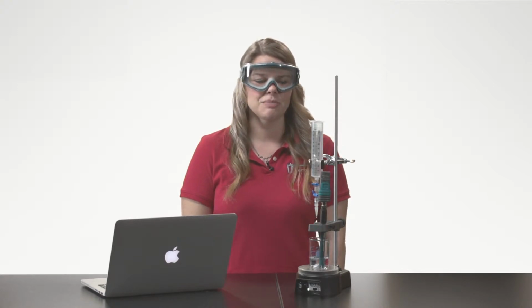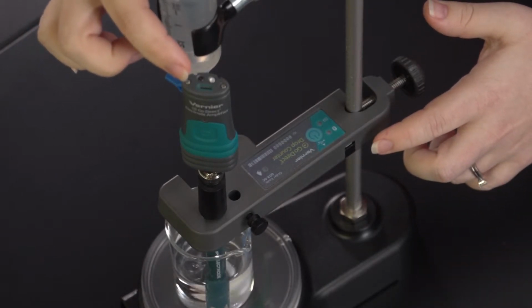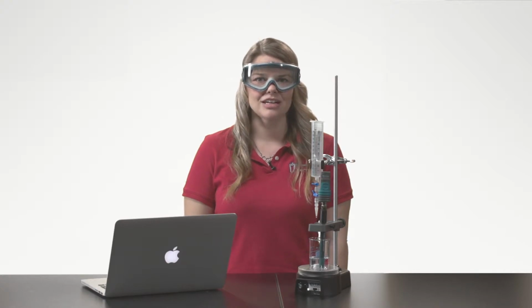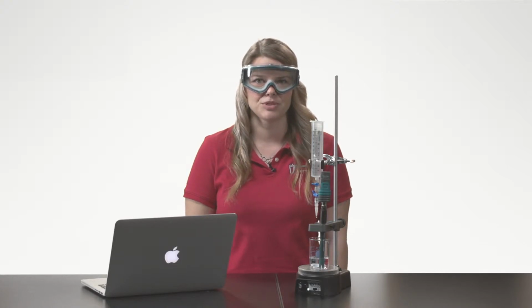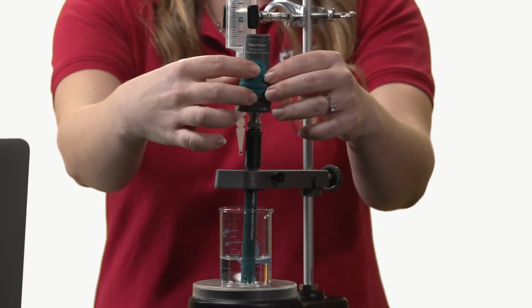The GDX-pH sensor and drop counter can be connected via USB or via Bluetooth to your platform. The platform can be a Chromebook, Mac computer, Windows computer, iOS or Android device. To get started, make sure you have downloaded the Graphical Analysis 4 app from our website or from the appropriate app store. Since I will be taking data via Bluetooth, I will now turn on my pH probe and drop counter.